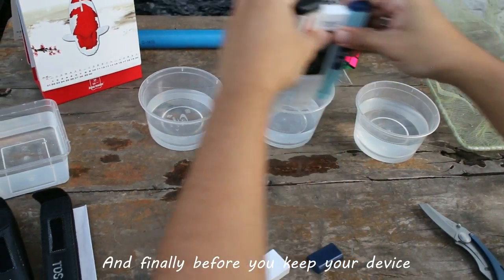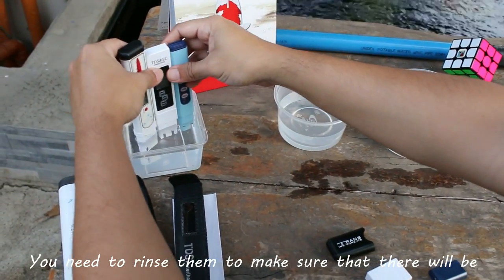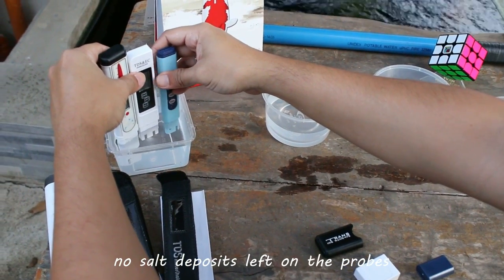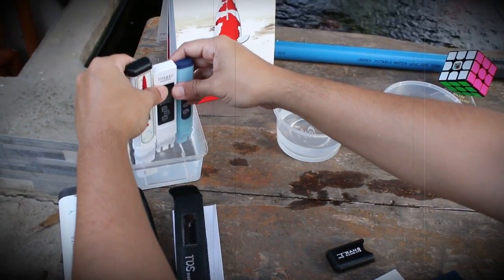And finally, before you keep your device, you need to rinse them to make sure that there will be no salt deposits left in the probes.